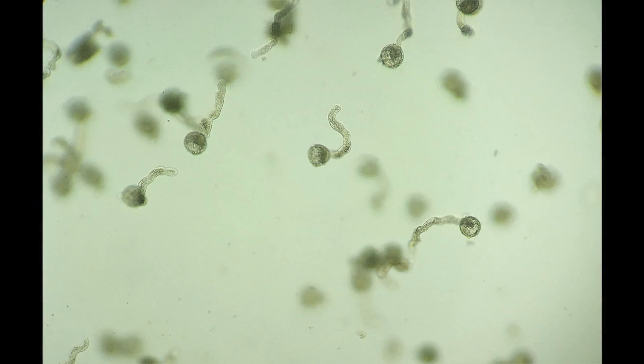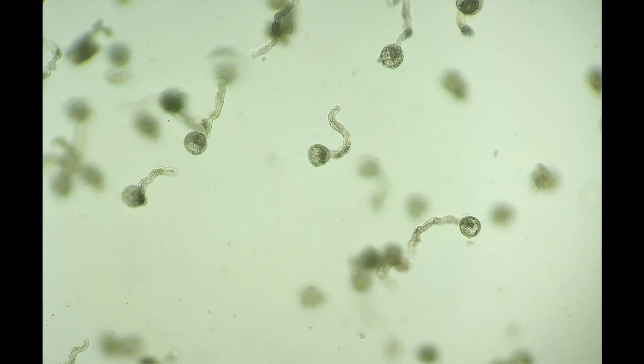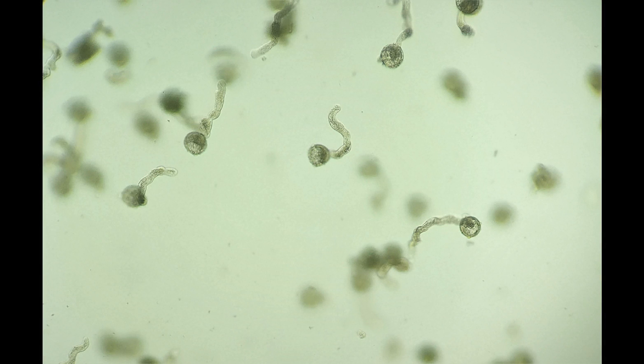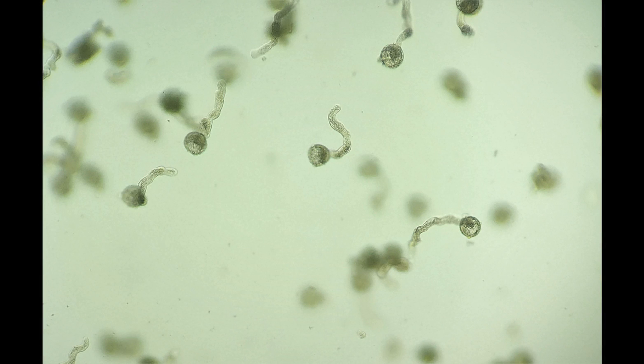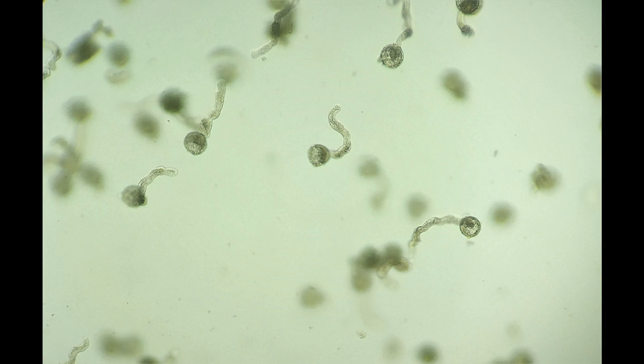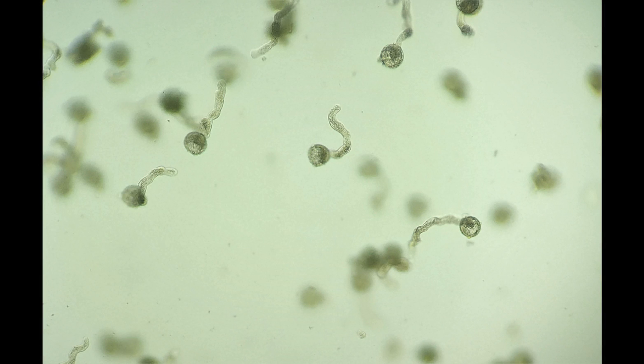In this video, we'll be performing a simple experiment to demonstrate the growth of pollen tube from pollen grains when exposed to an artificial pollen growth medium.